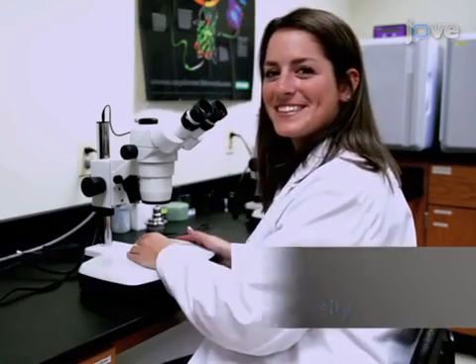Demonstrating this procedure will be Mary Rosell and Mona Gardner, both students in my laboratory.